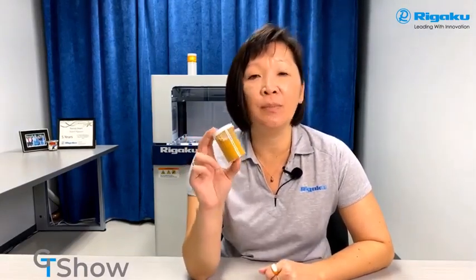Have you ever been in a situation where you have a sample that you want to build a quantitative method with, but you don't have standards and it's dirty? Like standard addition. Yes, today that's what we're going to talk about. We're going to show you how easy it is to create standards for your XRF analysis.